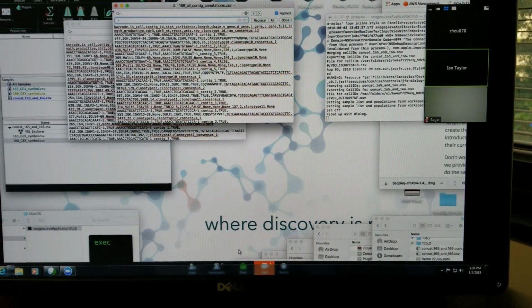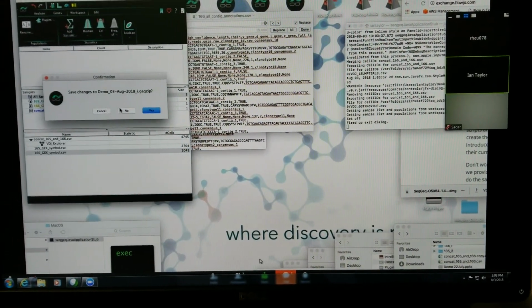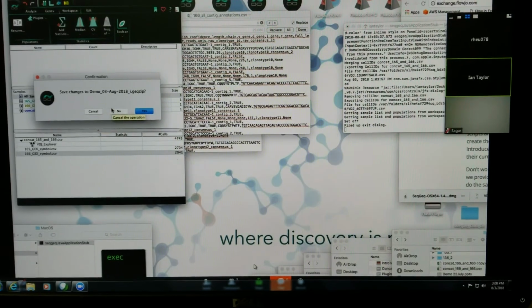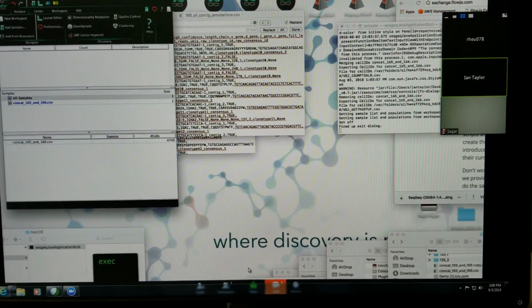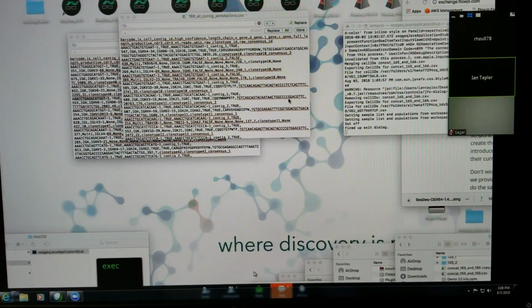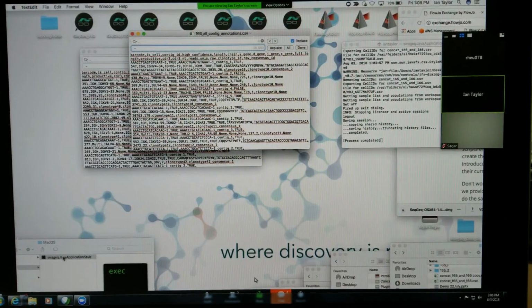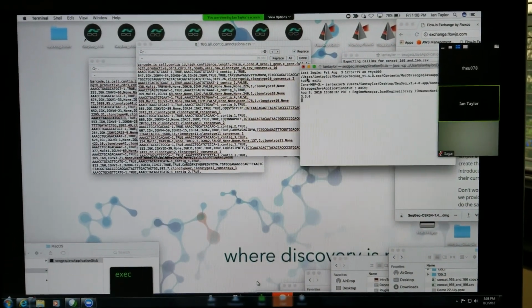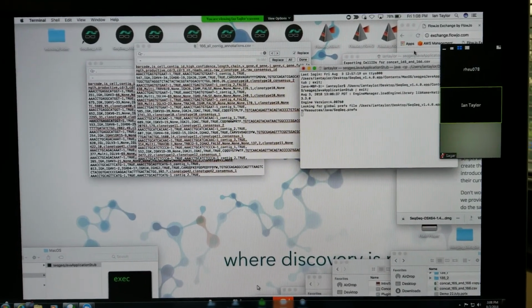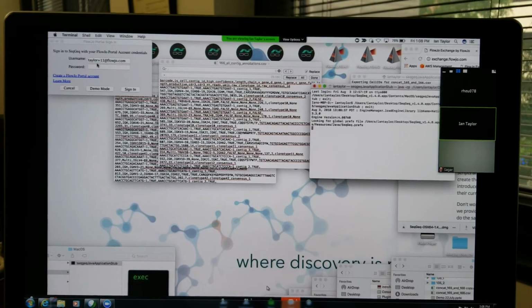So now that I've made these changes, I think I just want to restart SeqGeq to see if I can make those changes take effect. So I'm not going to save this. I'll quit completely. And then you'll notice, using a Mac, in order to get the console window open for SeqGeq, I'm just running from terminal, which is going to show me this window where I can see everything that SeqGeq's doing in the background.